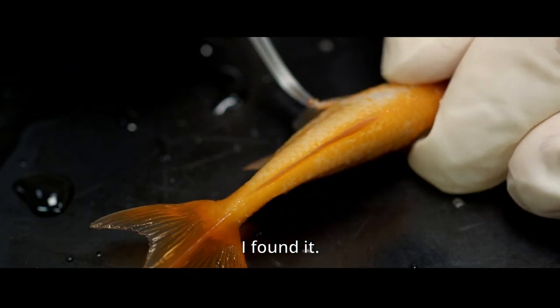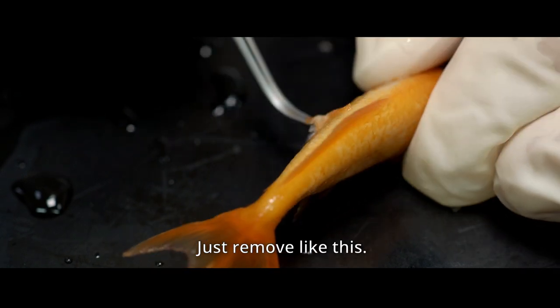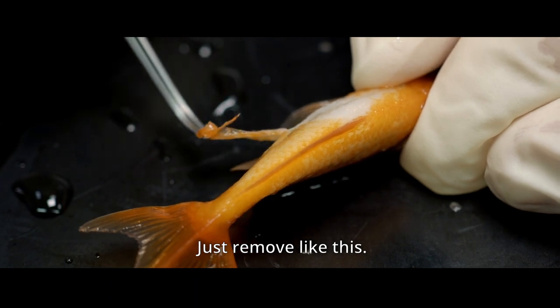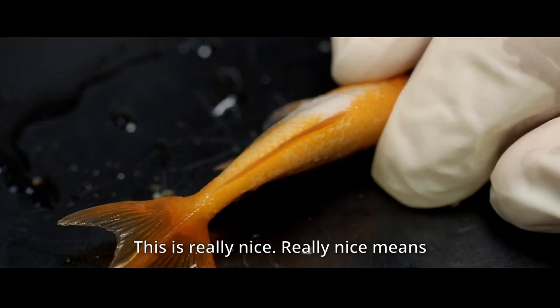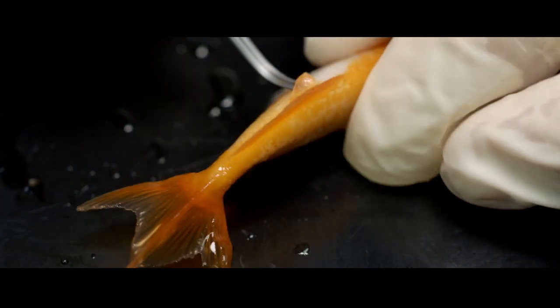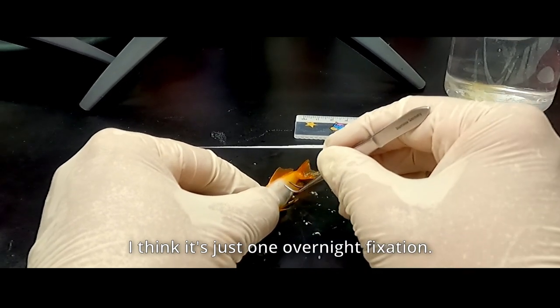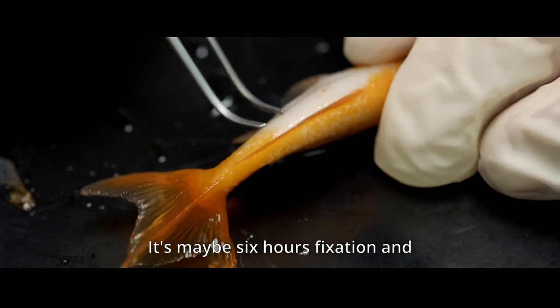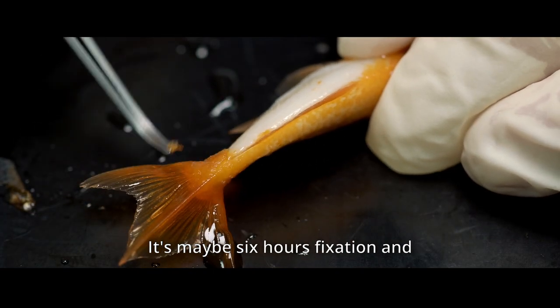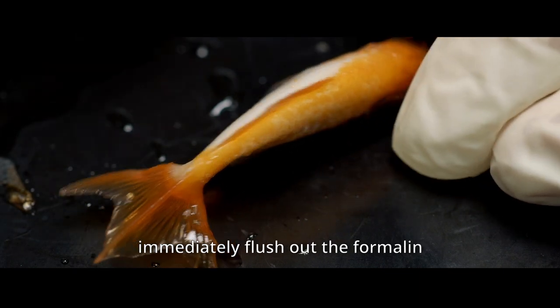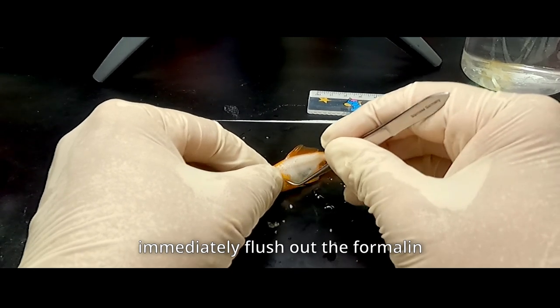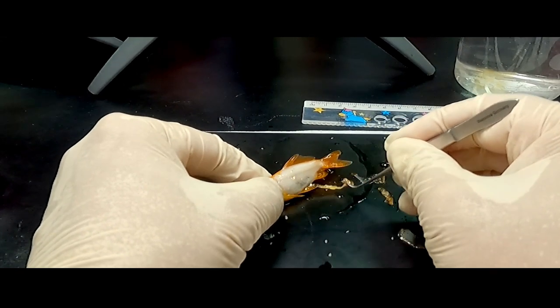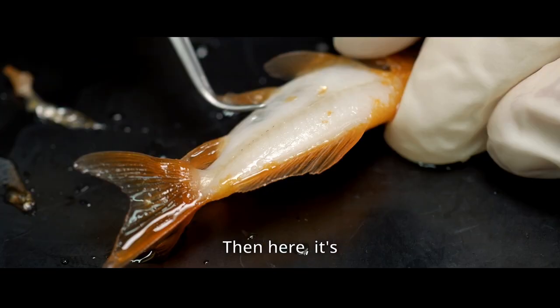And, I found it. And just remove, like this. And this is really nice. Really nice, I mean, just one overnight fixation, or maybe less than overnight also okay. Maybe it's maybe six hours fixation and immediately like flush out the formalin and remove the skin. Something like this. And then, here is slightly damaged, but still.